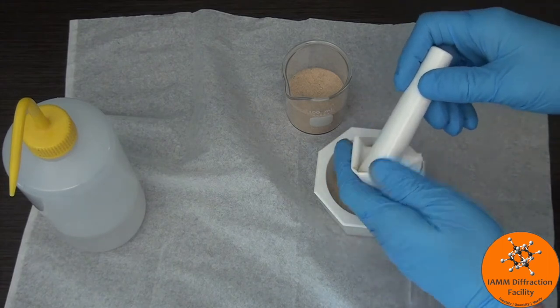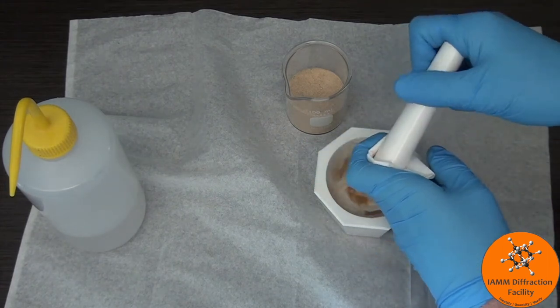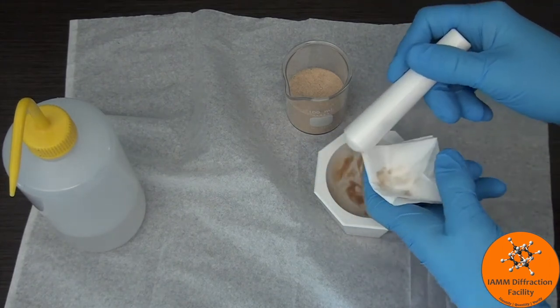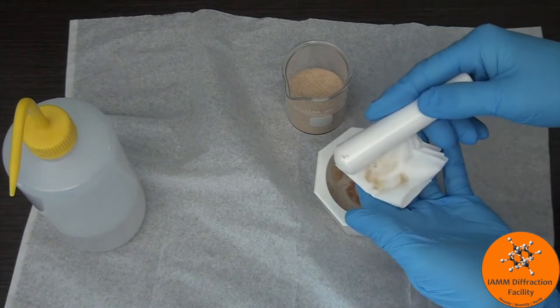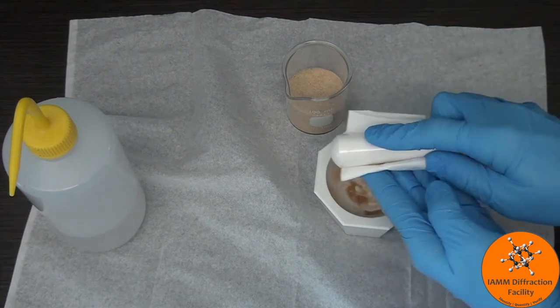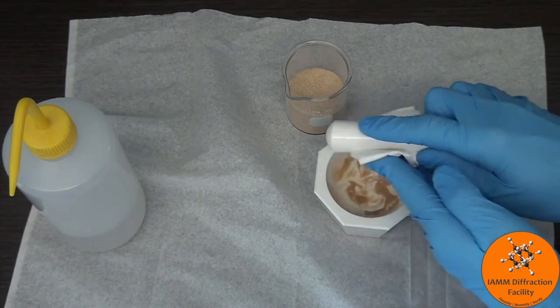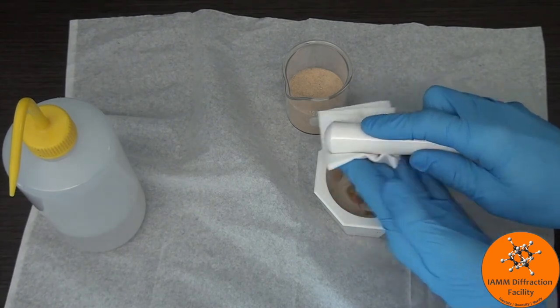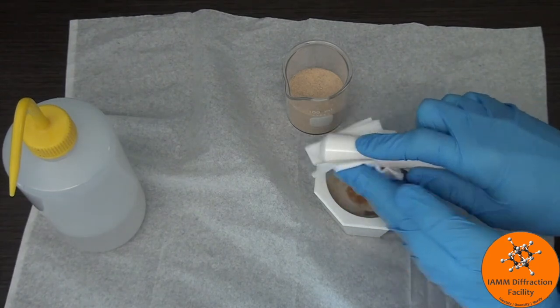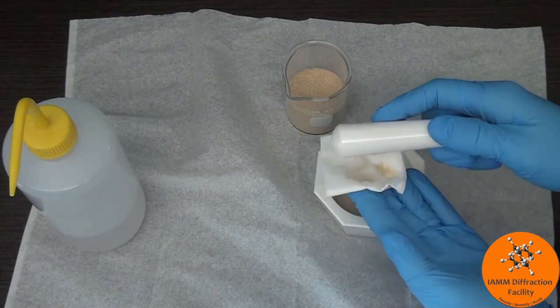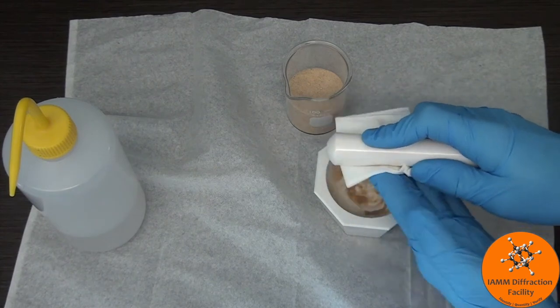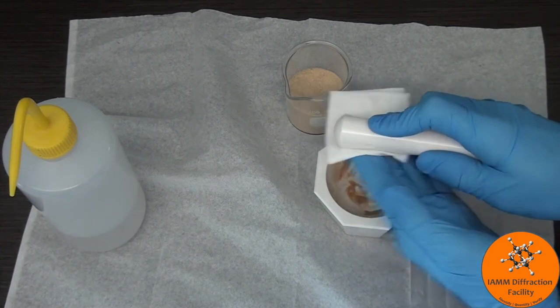I'll wipe that off. See, there's a little bit of dirty marks on the side there. I might just take some of that sand, kind of scrub at it. And that seems to be doing a pretty good job of getting those darker marks off the pestle.